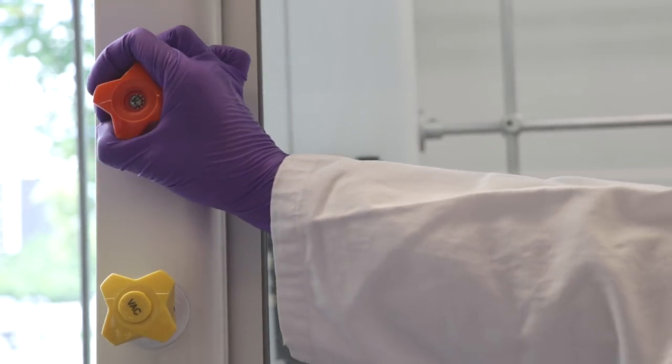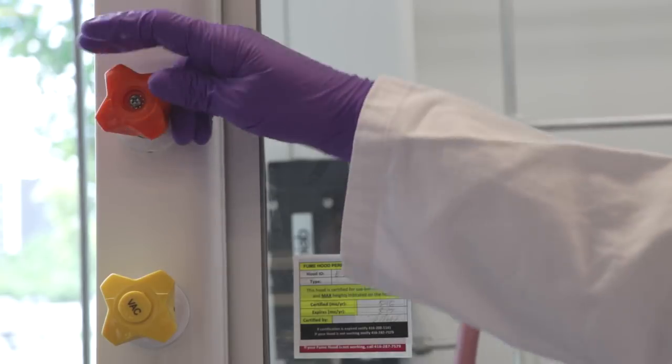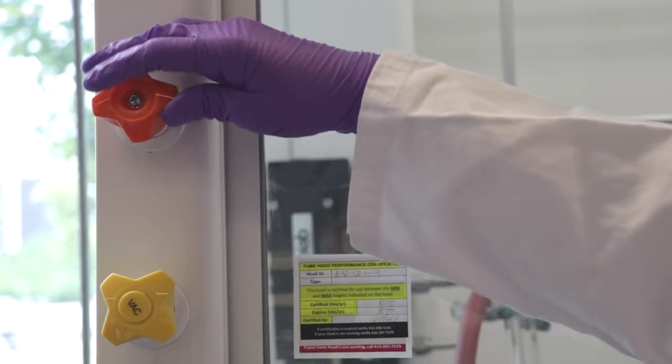If you're working in the ESCV building, make sure you turn the orange knob to turn on the vacuum pump.